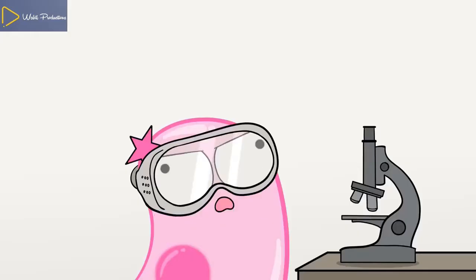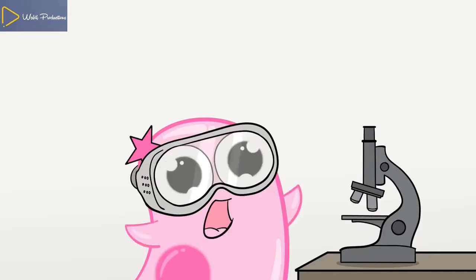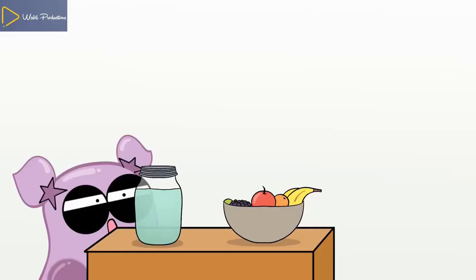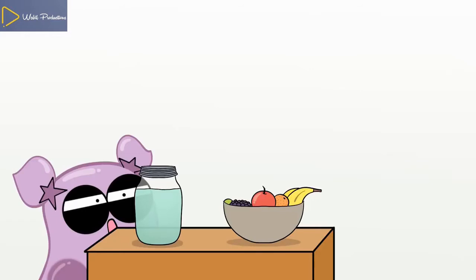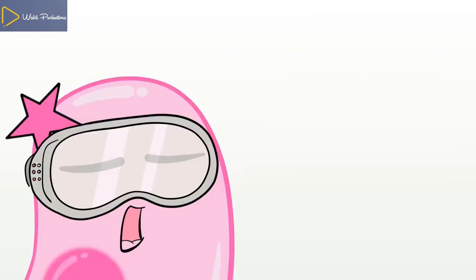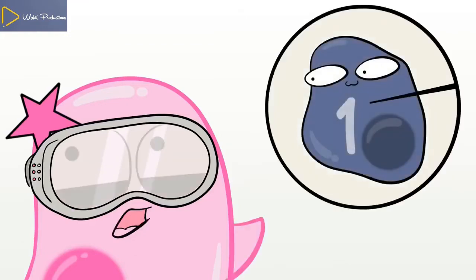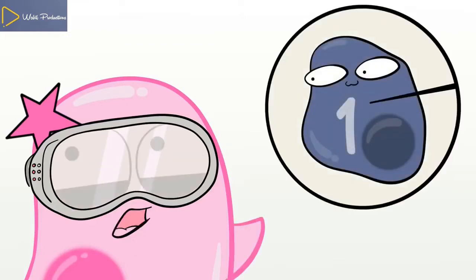Green water? Don't be ridiculous, Petunia. There are tons of protists in here, we just have to find them. The protists that I'm looking for are unicellular, meaning they're made up of one cell. And generally, you need a microscope to see them.